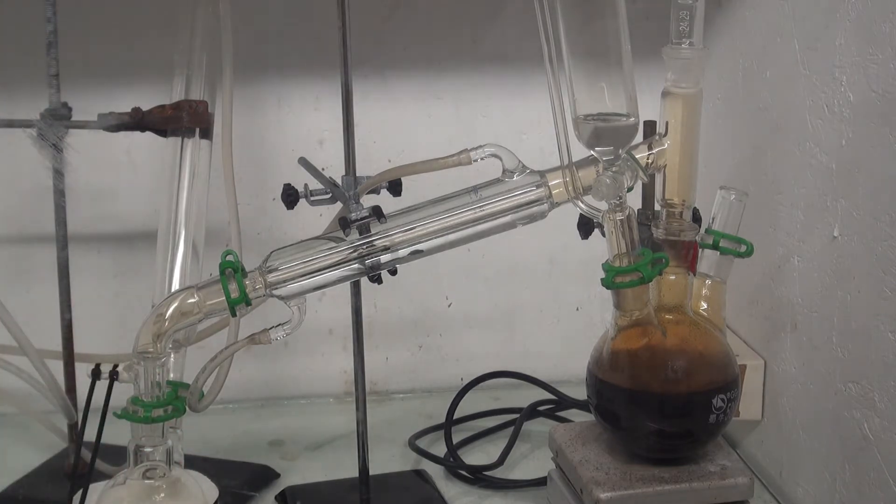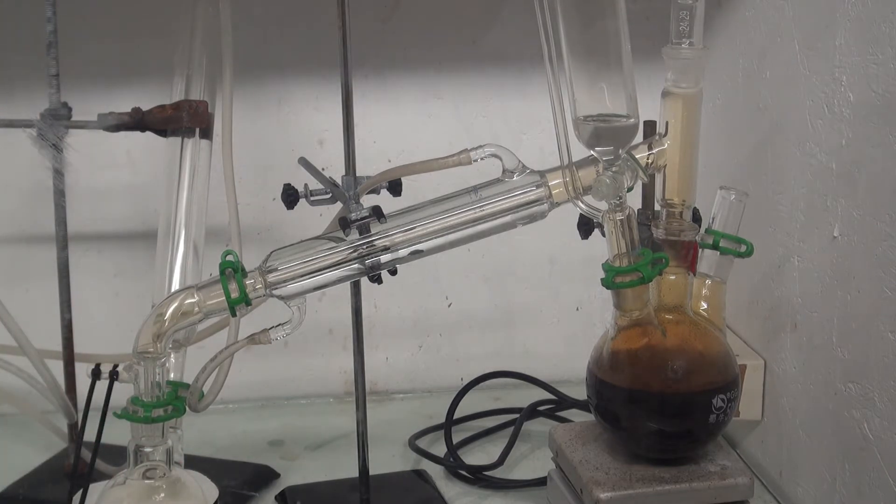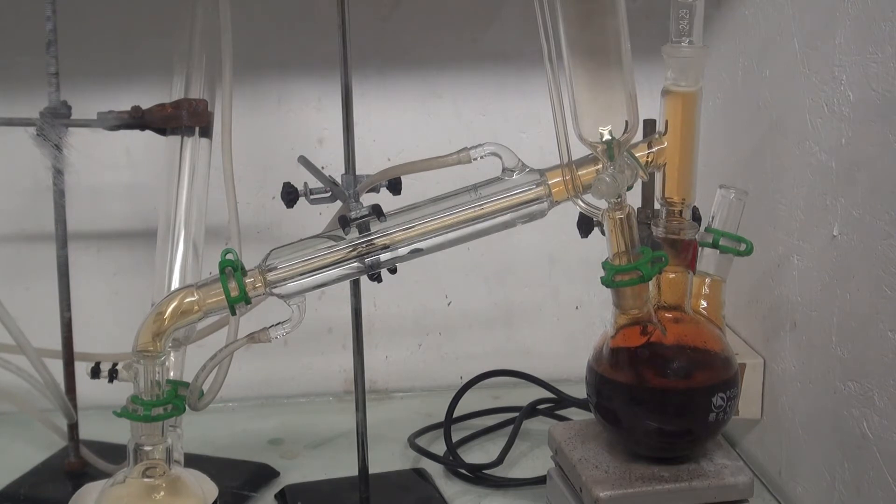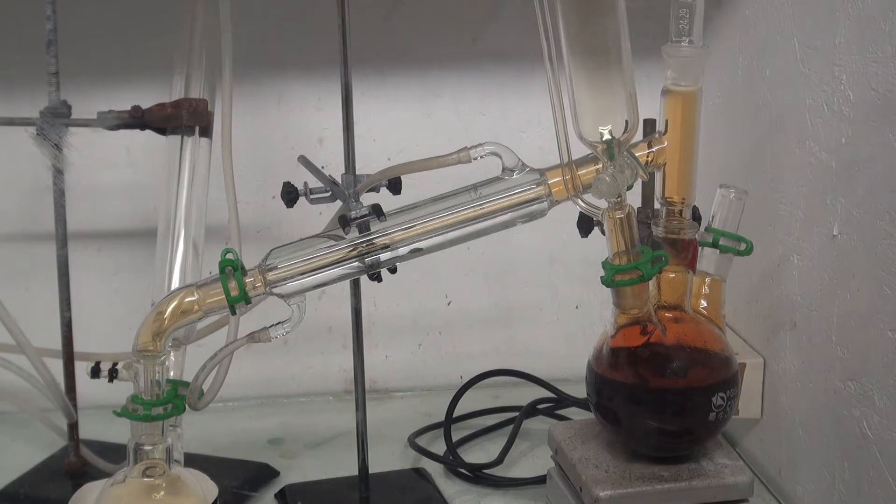Because of the big loss in the hydrobromic acid preparation, nearly all the bromine dissolved in the water and a little bit fumed away. I didn't bother to distill that little bit out.